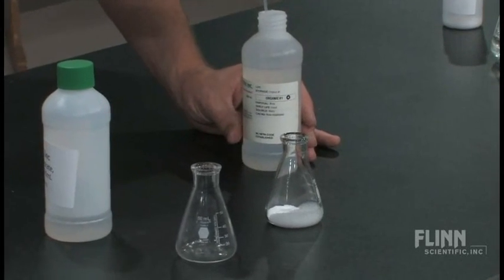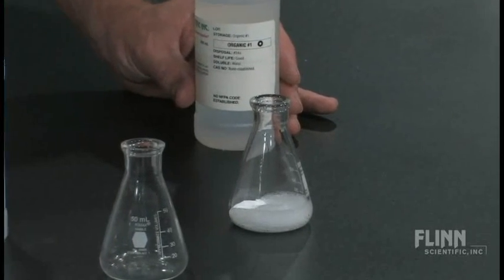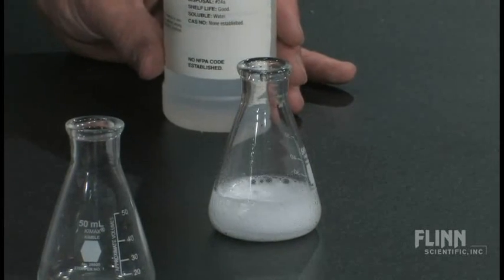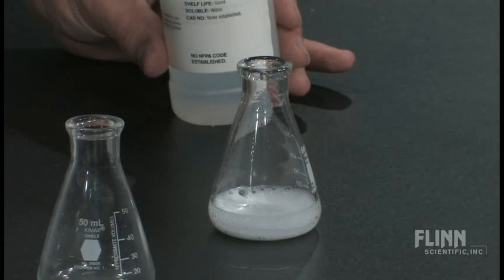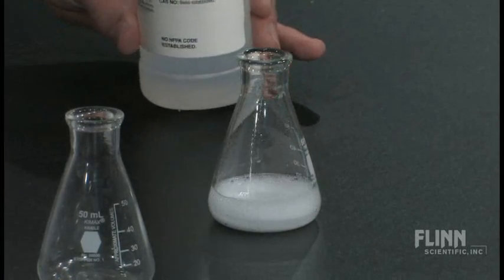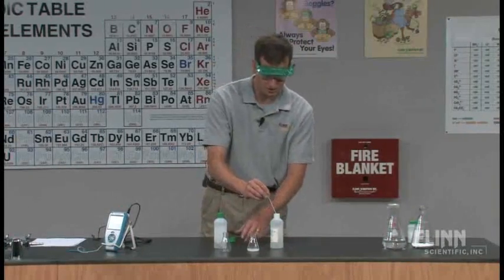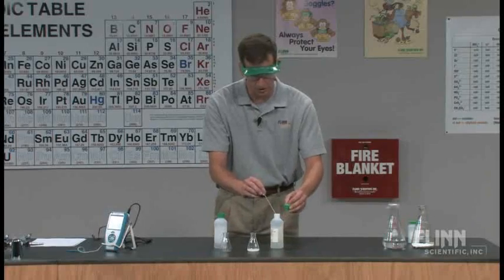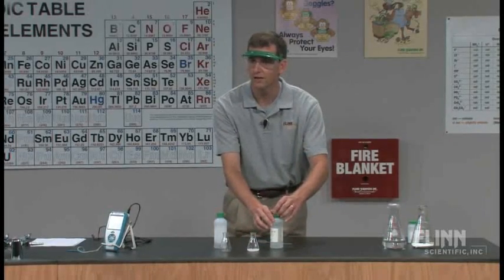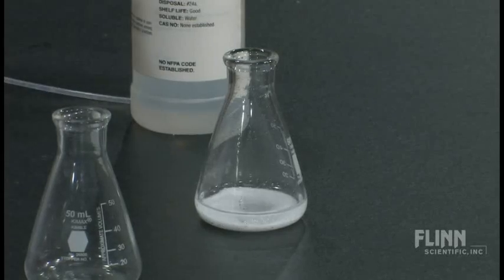The students are watching and making observations. They've seen it quite a few times by the time they get to high school or middle school. I see a lot of frothing, I see gas being released. And what we have them do, since we're in the thermochemistry part, is we want to look at that and say: I see bubbling, I see frothing — is that container releasing heat energy or absorbing heat energy? Is that an exothermic reaction or an endothermic reaction?